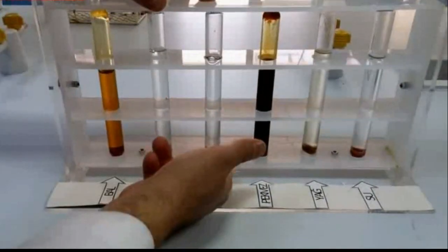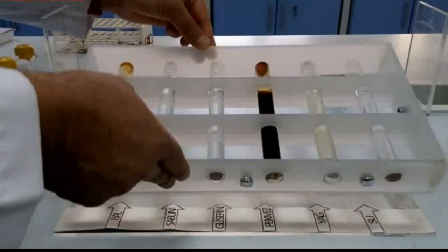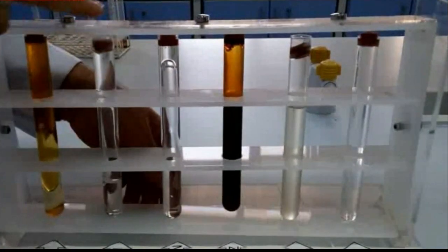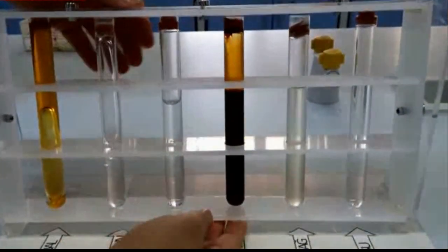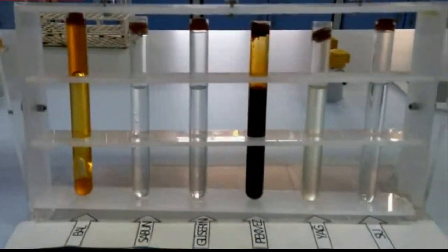And now, we will try to do it slower this time. Slower, and we clearly saw that viscosity of honey is greater than that of others.